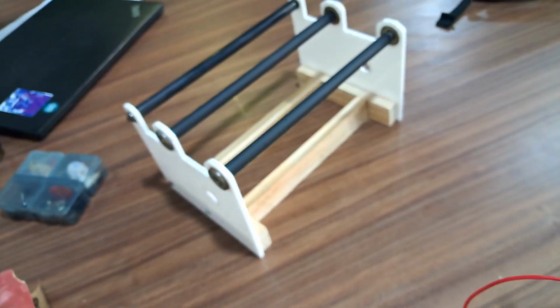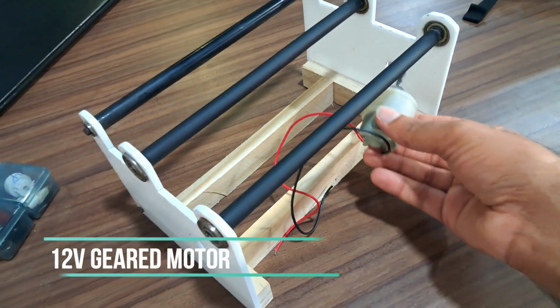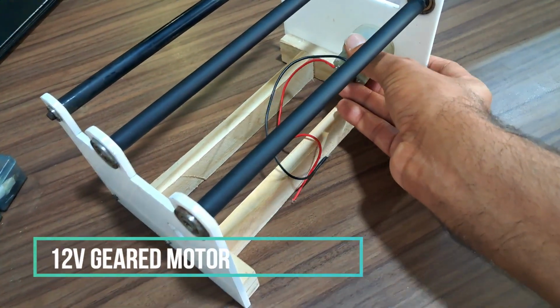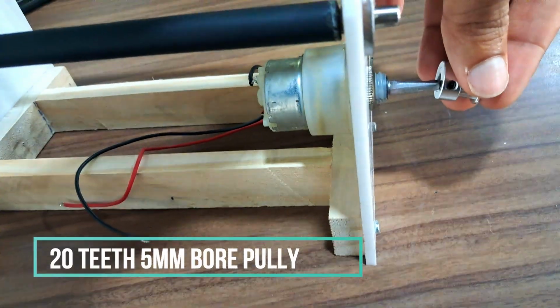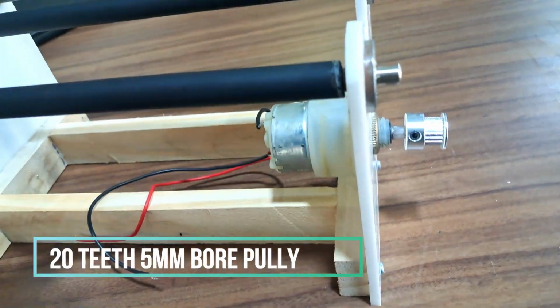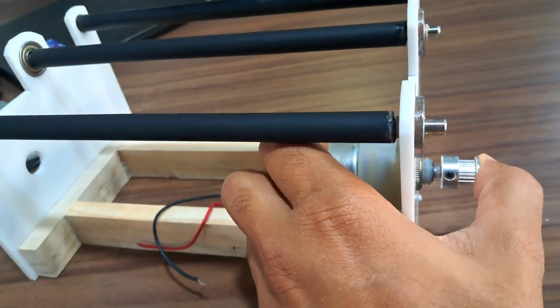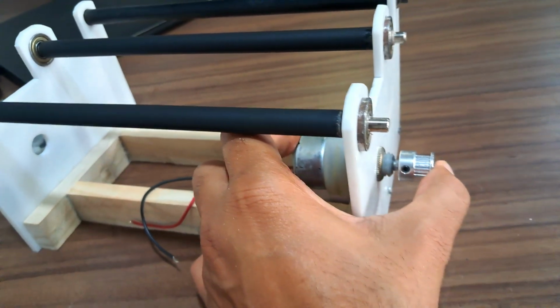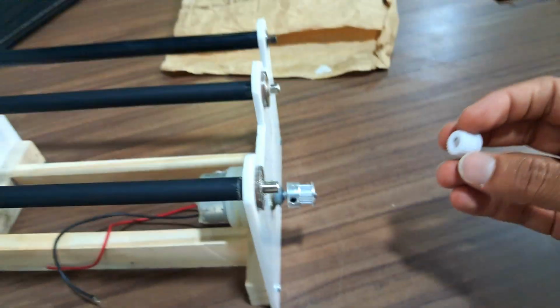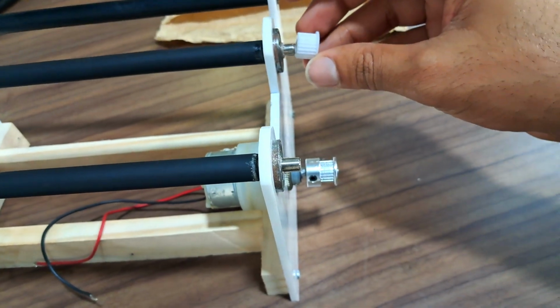After placing the rollers, now I will place the motor. This is the 12-volt geared motor. This pulley will rotate our rollers. The same pulley will go on the rollers.